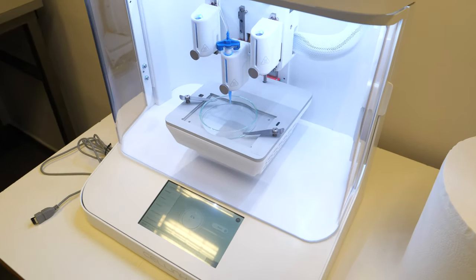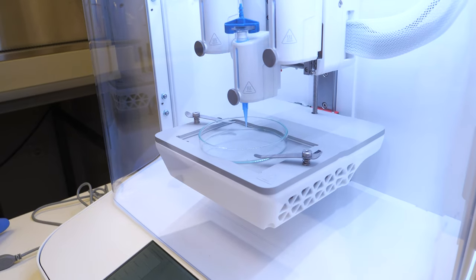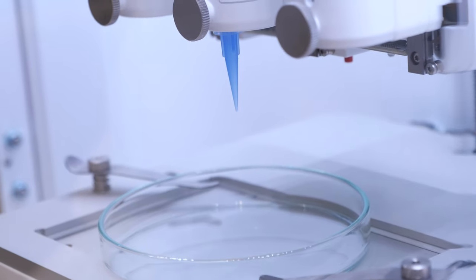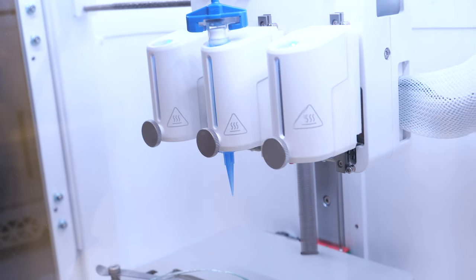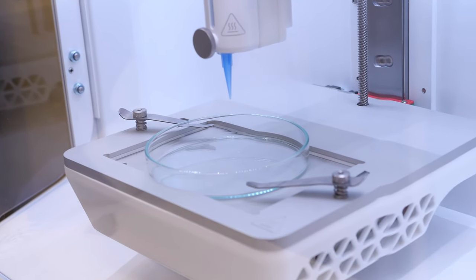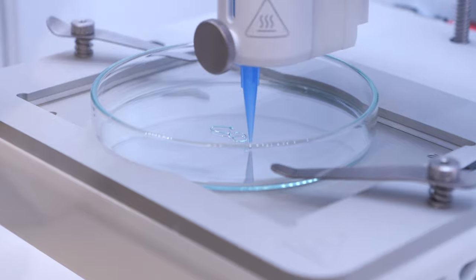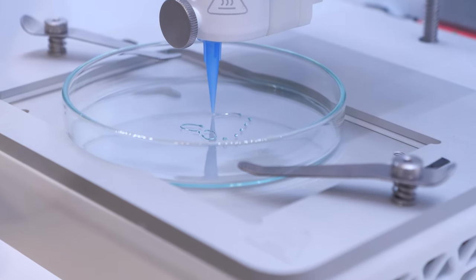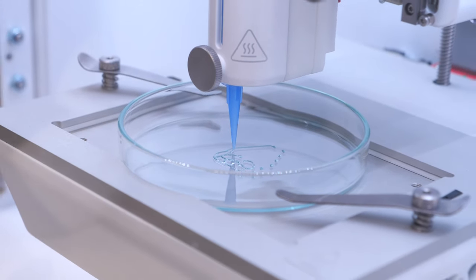To bioprint, we combine special biomaterials that mimic native tissue together with cells. Starting the bioprinting process — it's going to take around five minutes to print the nose. Of course it's just a model; we are still far from the desired results worldwide, but this is a very powerful research tool. We have the 3D model of the nose, sliced it to create a language the printer can understand, and now the printer deposits material wherever we dictate.